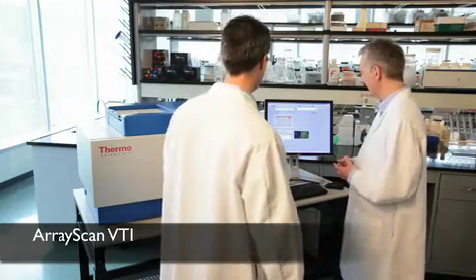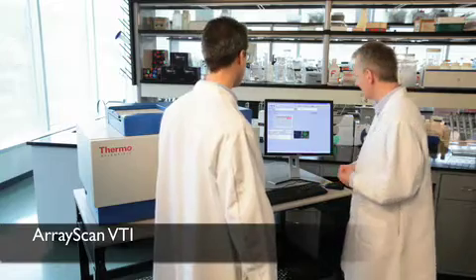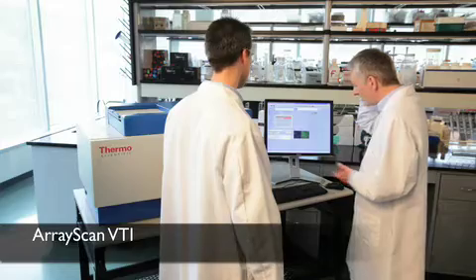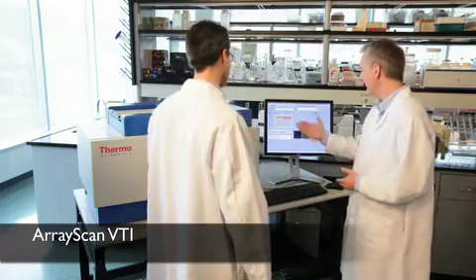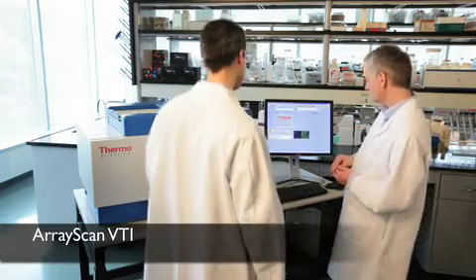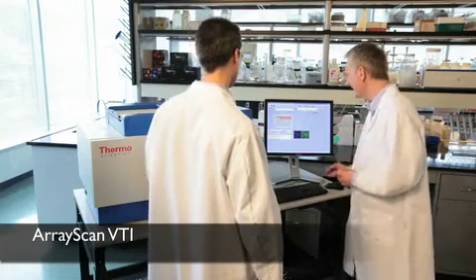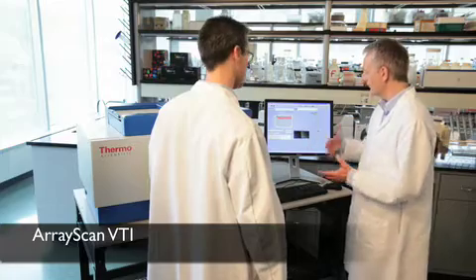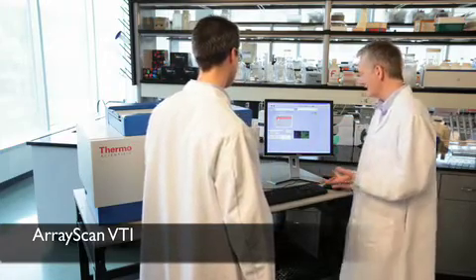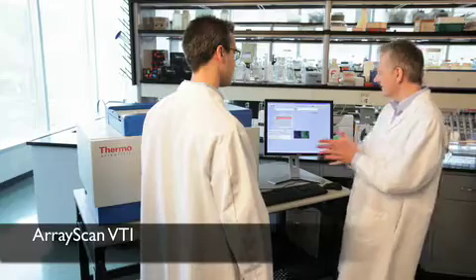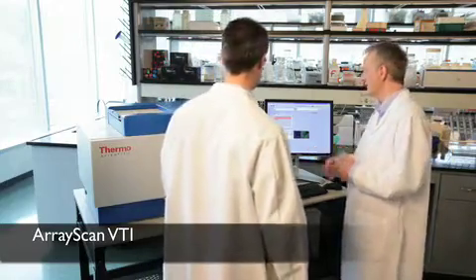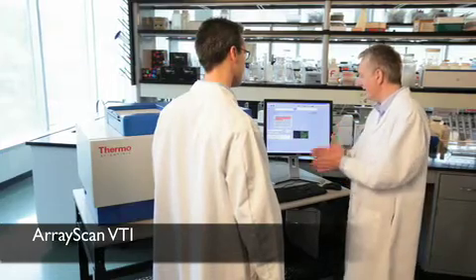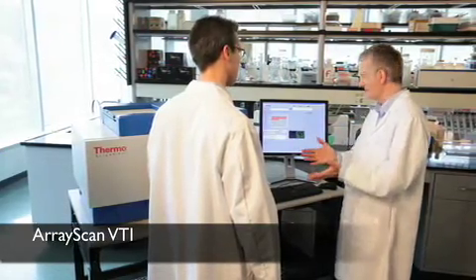And they have a big range of them. So they're kind of ideal for these kind of biologies that we're doing here. Very simple to use. So away we go. We're skipping through the wells quite nicely. It looks like it's going to take us about four minutes. It might come down a little bit in time. So this heat map kind of shows you roughly what's going on in your biology, which is nice. But also, like I mentioned, we're making these real-time image analysis measurements. So that's one of the nicest things about this system. One of the reasons why we purchased it was at the same time as acquisition we're doing real-time image analysis.